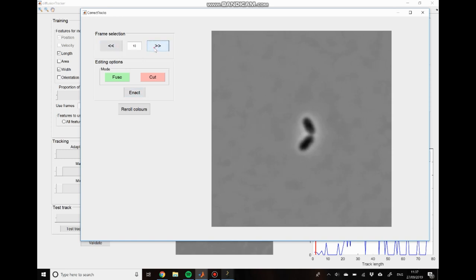which was faulty. And we can continue scrolling through and we see that we have this other cell which has a mistake in it as well. So we click enact there. This is an interesting example here. You can see that we have the end of a track in cyan here, but also that we have this dark orange line in the middle.